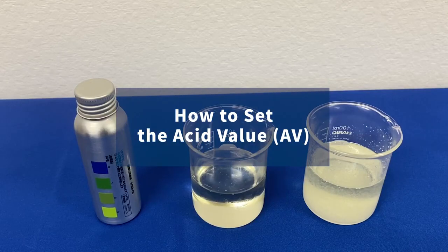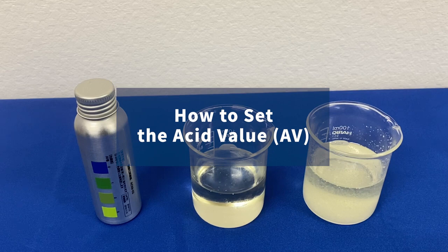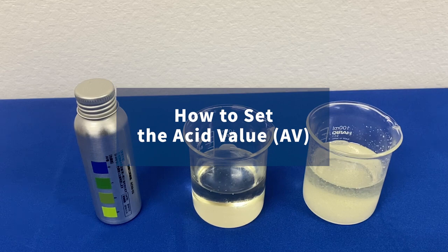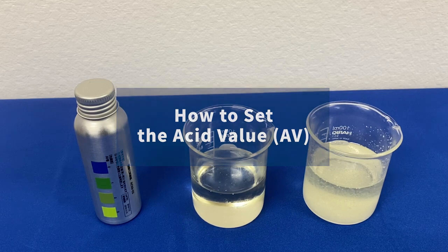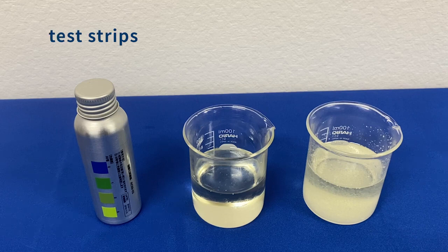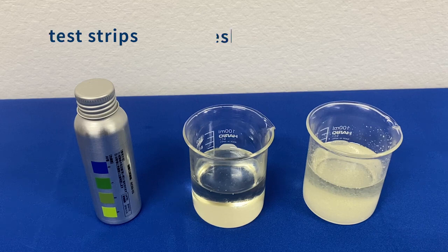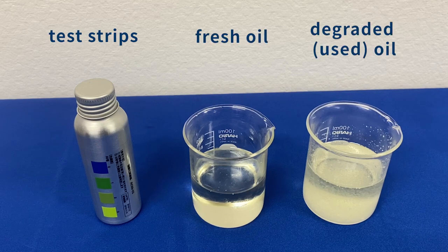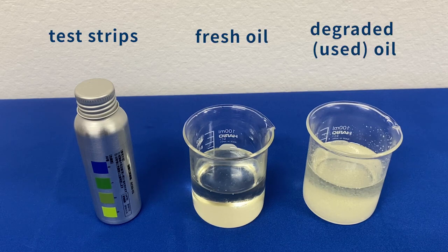How to set the acid value scale, AV. Three things will be needed for measurement: test strips, fresh oil, and degraded or used oil.